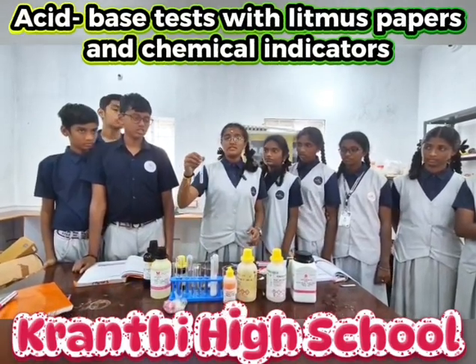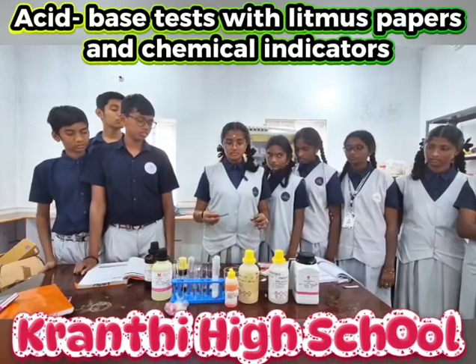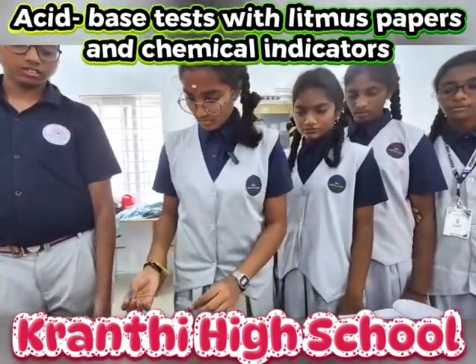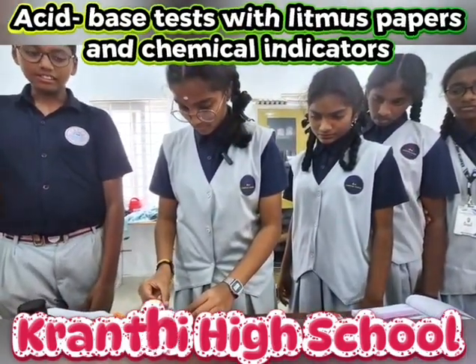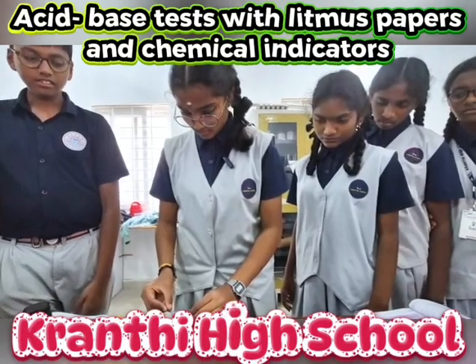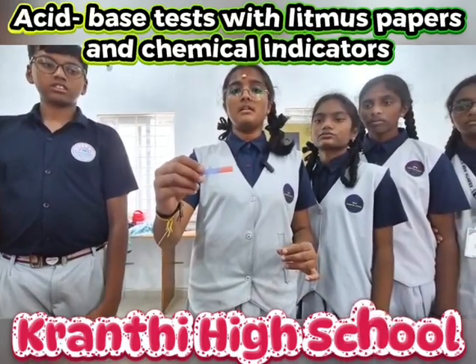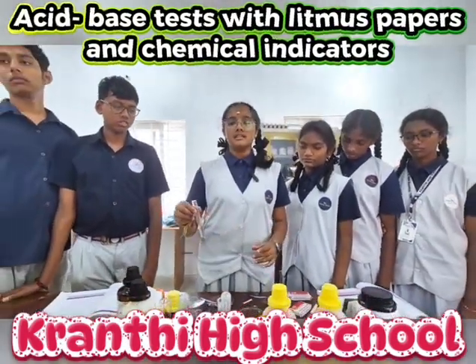This is the diluted solution of HCl. First, we'll dip blue litmus paper into it. As you see, the blue litmus paper has turned into red. It shows that the HCl is an acid.